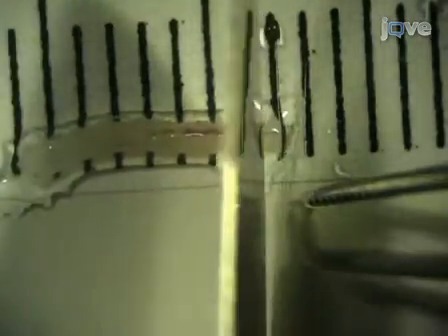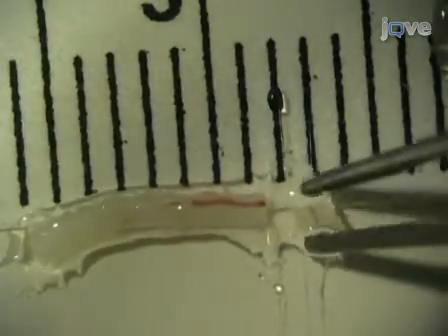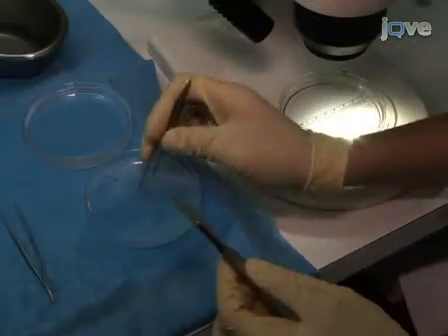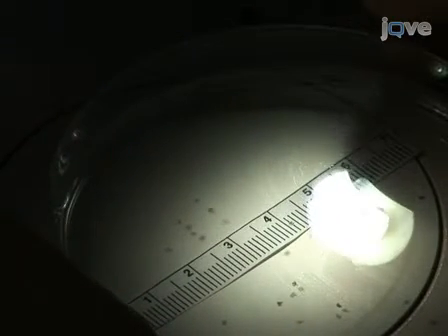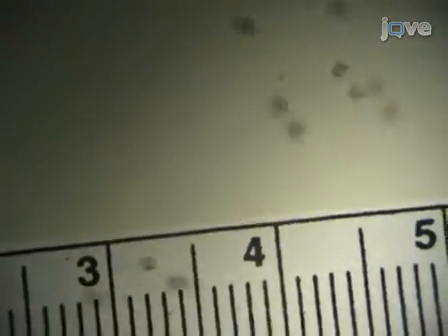Now that the thoracic aorta is clean, use a surgical blade and work under the binocular to slice the aorta evenly into 1 mm rings, using a ruler placed below the cutting surface as a guide. Make sure to use a new blade and replace it from time to time to maintain sharpness. The ends of the aorta are not used. After cutting each ring, use tweezers to transfer it very gently into a new dish containing cold PBS. Place all the rings in the same PBS-containing plate to ensure that the assay is randomized, since each segment of the aorta has a somewhat different angiogenic potential. Keep the rings on ice.